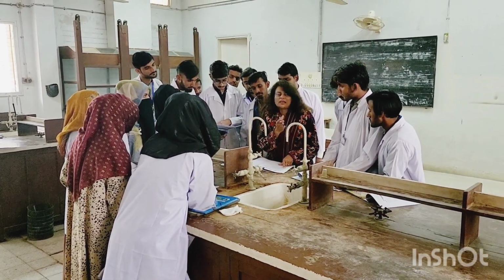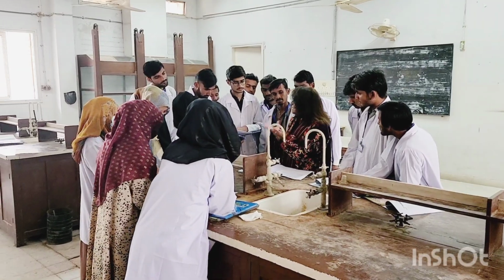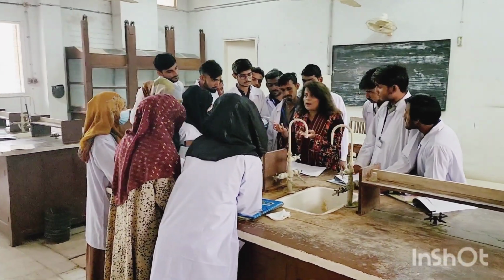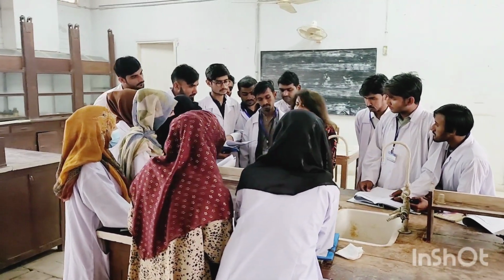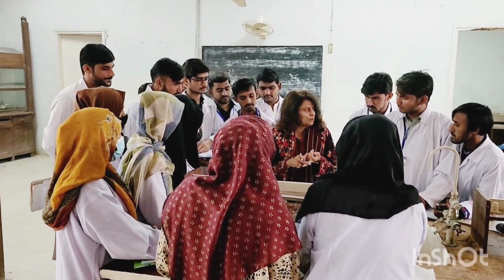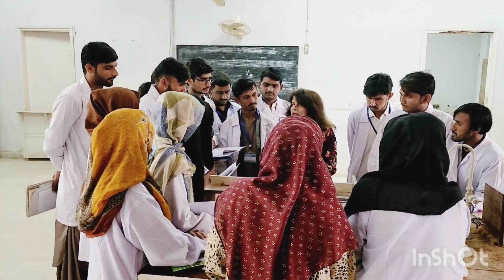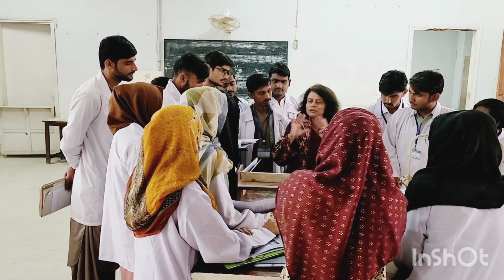Detection of elements. We know that our organic compound is loaded with carbon and hydrogens. But besides carbon and hydrogens, what other elements are there? So we are going to look for if nitrogen is there, if it contains halogens, chlorine, bromine, iodine, fluorine, if it contains a sulfur group. But for that, I will tell you at that time.